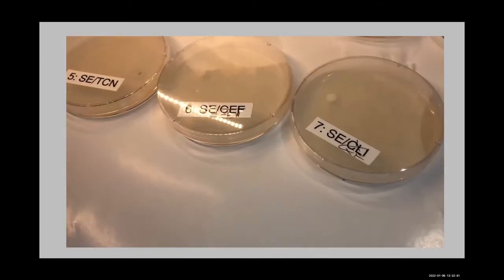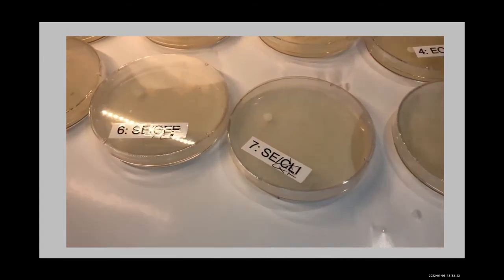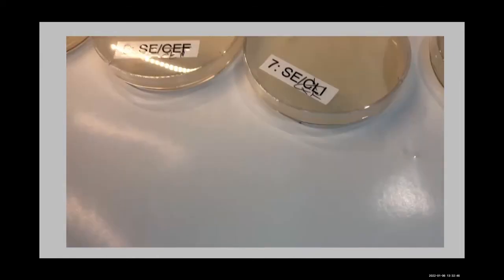Well, here they are, and you can see we did fix those labels. So we now know what we're dealing with here.